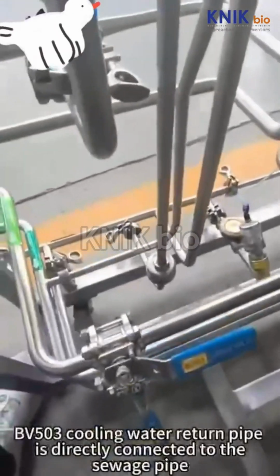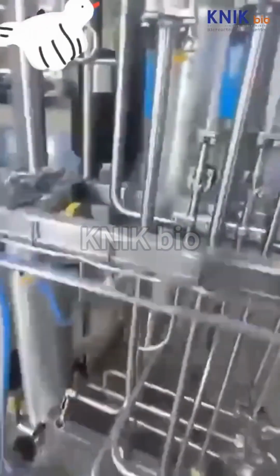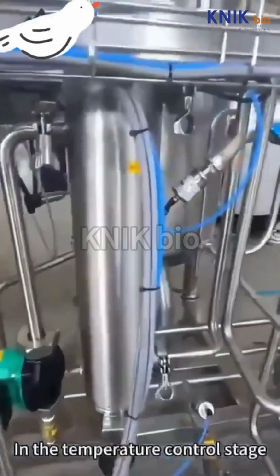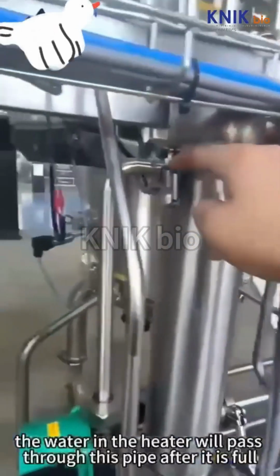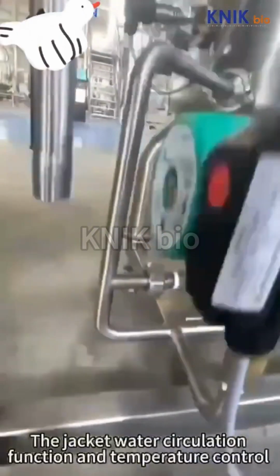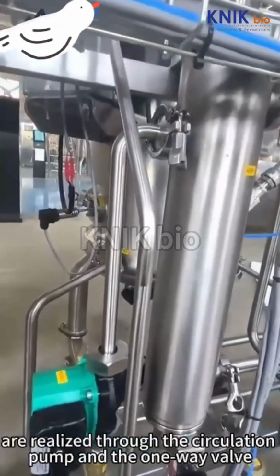BV503 cooling water return pipe is directly connected to the sewer pipe. BV504 chilled water return pipe is a separate pipe connected to the chilled water outlet. In the temperature control stage, the water in the heater will pass through this pipe after it is full. The jacket water circulation and temperature control are realized through the circulation pump and the one-way valve.